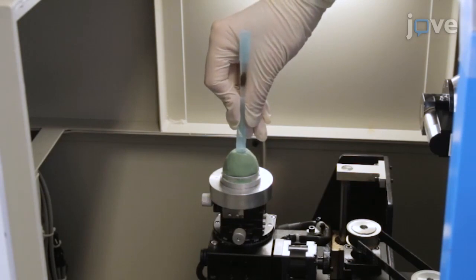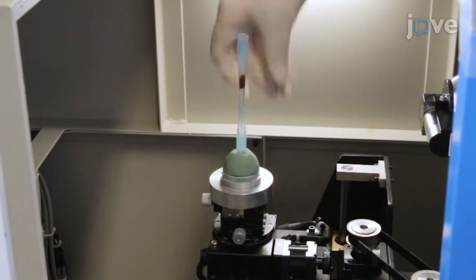It can be performed with common materials such as water, clay, and tubes, and is applicable to samples with a variety of shapes, from a long worm to a round ball.